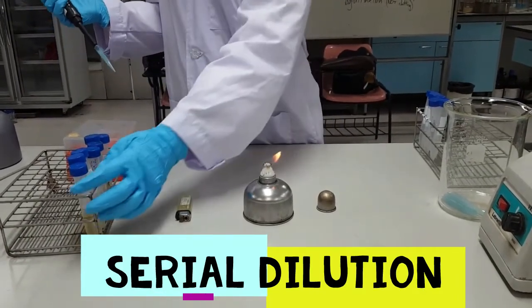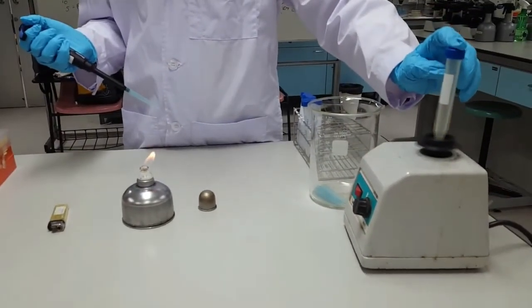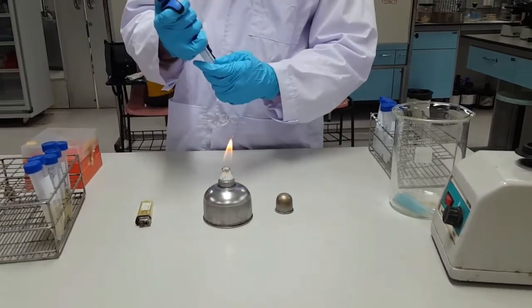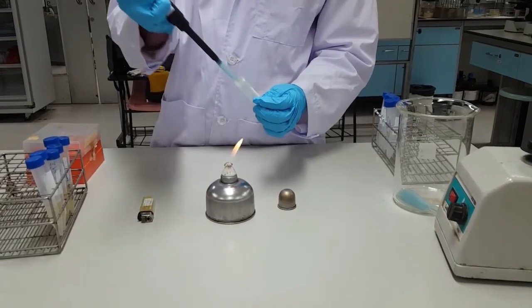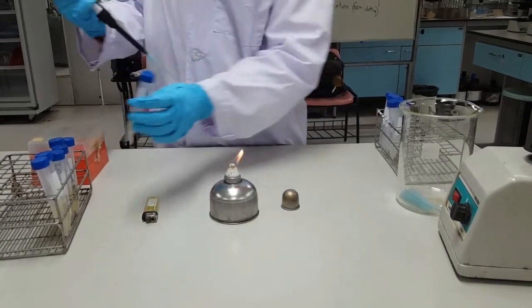To start, you want to pick up your micropipette and put on a sterile tip. Take your first broth culture, spin it on the vortex. You're going to want to flame the lid, take the top and then flame the mouth as well. Then you want to insert your micropipette to pick up part of the culture. Then you're going to flame the mouth once more.